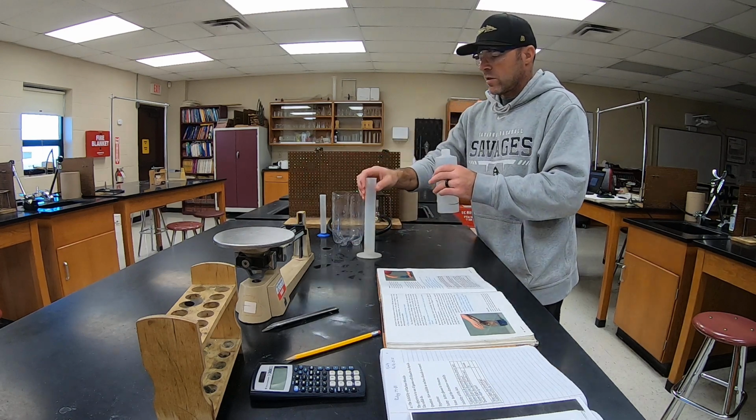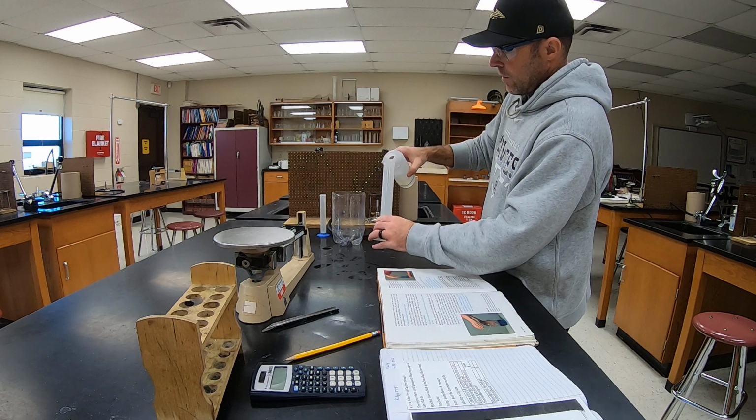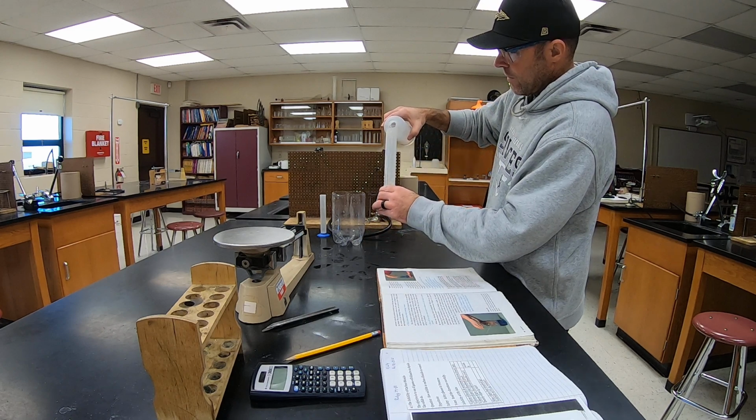So I've got a graduated cylinder here, and we're going to fill it up to 100.